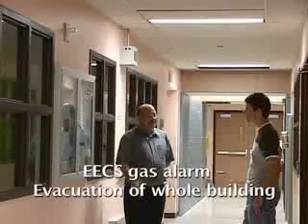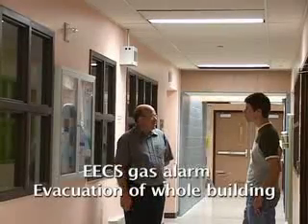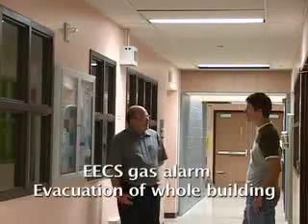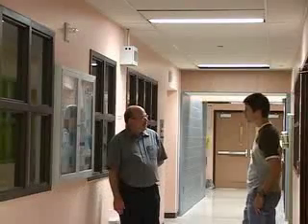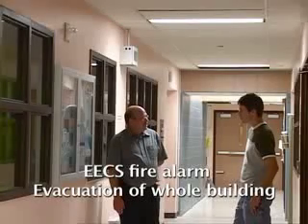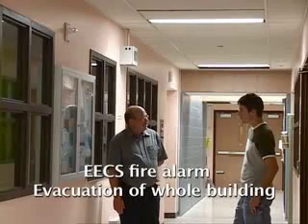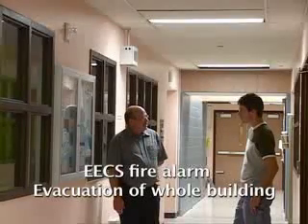Toxic gas leak. Toxic gas leak. Evacuate immediately using a northwest exit. Attention. Attention. Attention. An emergency has been reported. All occupants walk to the nearest stairway exit and walk down to your assigned re-entry floor or main lobby.